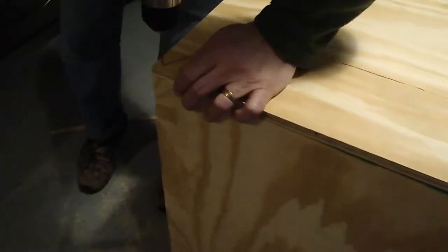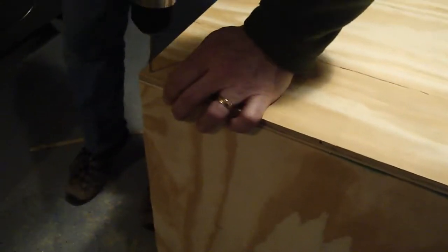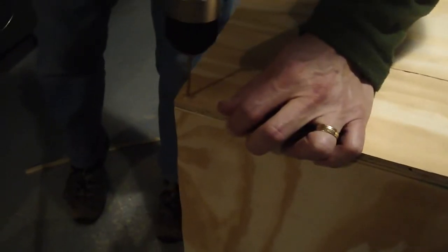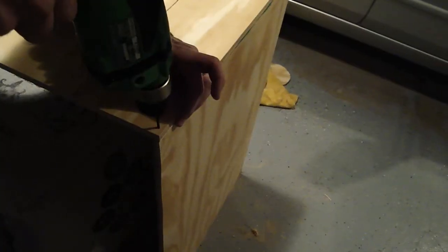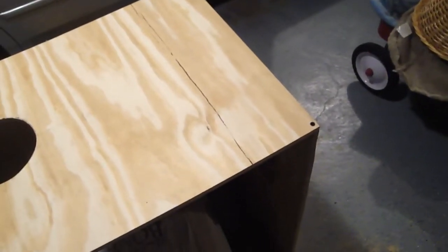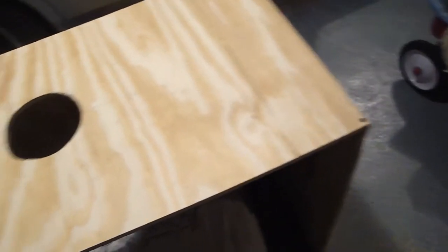Drilling our first hole on the top. Put the screw in. So you put that screw in the front there. We're going to put this screw in the front here. So we've got the front totally screwed down, and then we'll start working on the sides and the back.